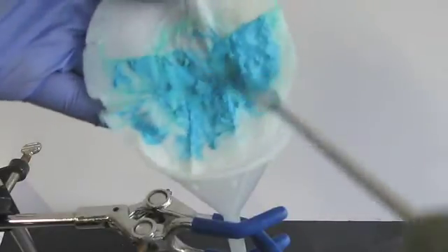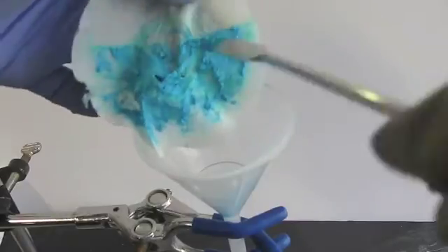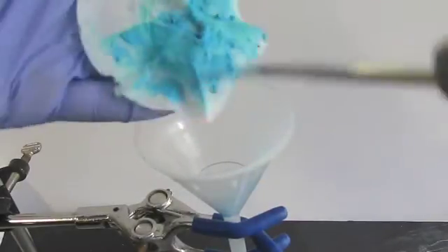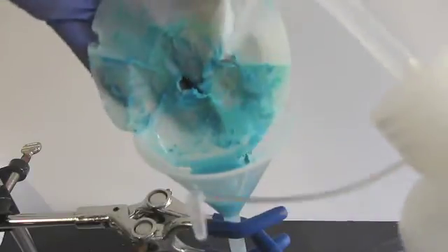Now you'll want to scrape your wet product into the funnel. Be sure to keep the filter paper and let any remaining goop dry on its own, so that you don't lose any of your product. If your compound is insoluble in water, you can try to rinse as much as possible into the funnel. However, if you're dealing with a soluble compound, it is best to rinse sparingly, if at all. Also, try not to tear the filter paper like I did.